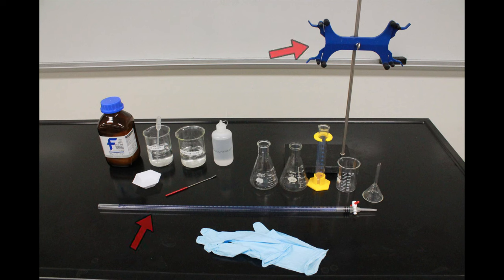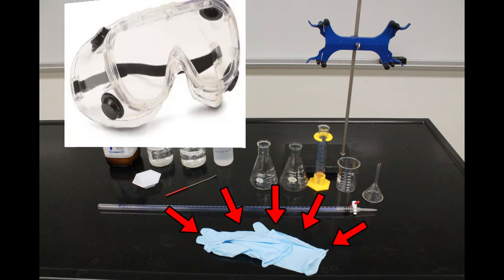A burette and a burette stand, and some various glassware to measure with, dissolve your KHP in, and collect waste. And of course anytime you are working with chemicals you need to be wearing gloves and your safety goggles.